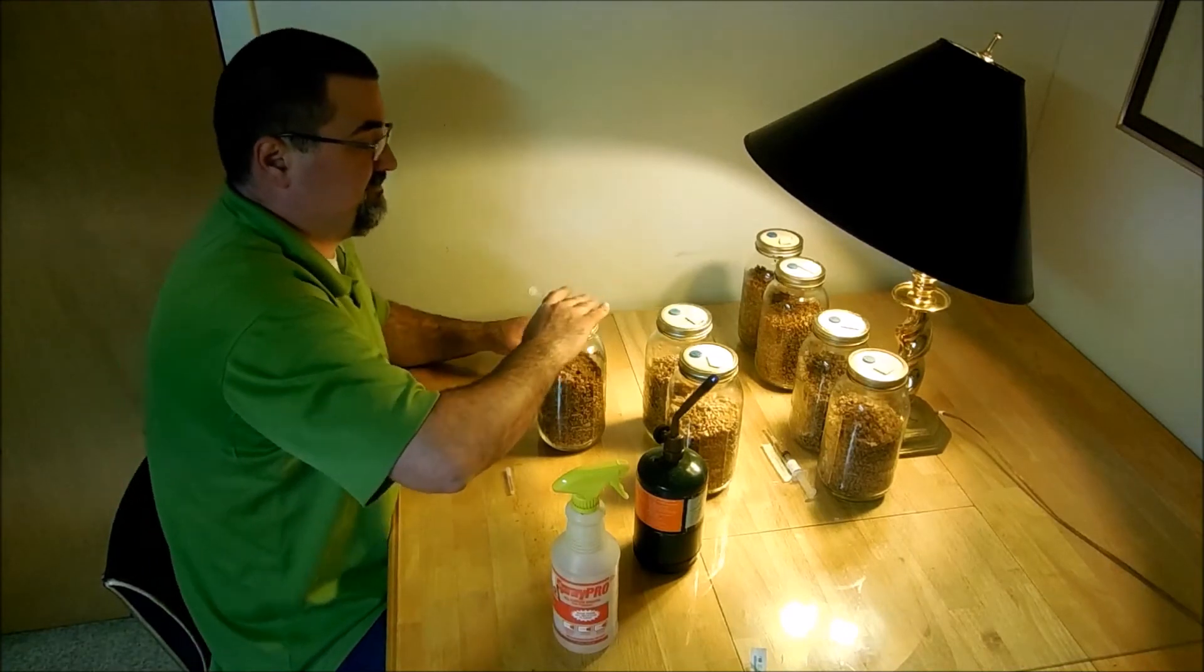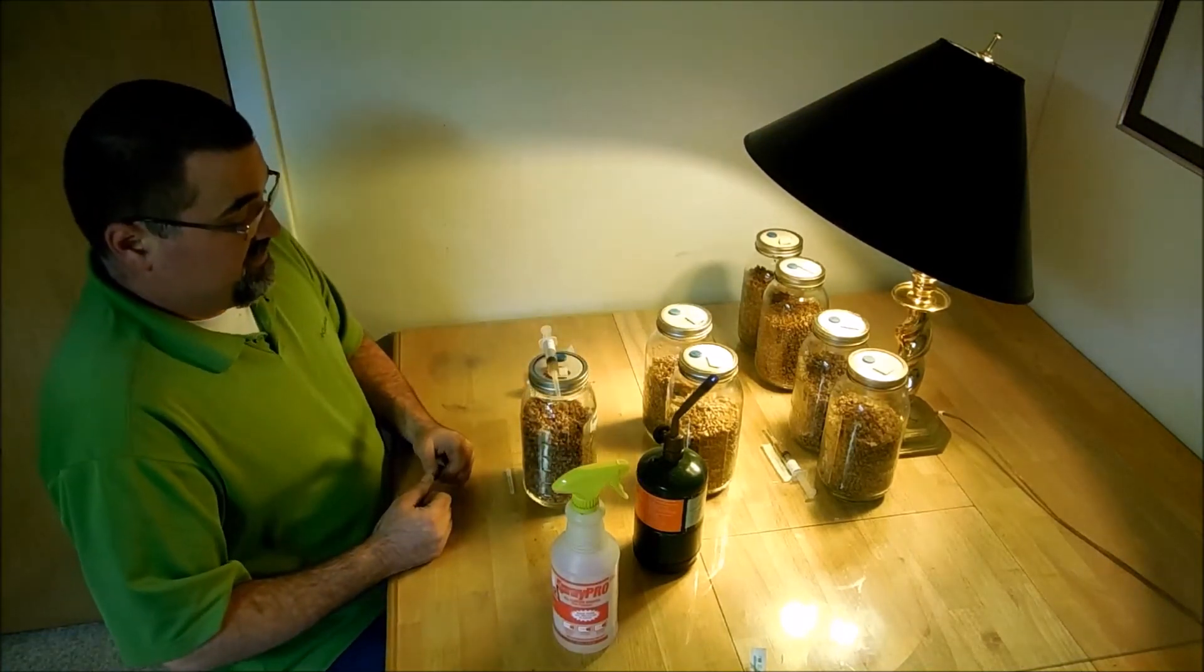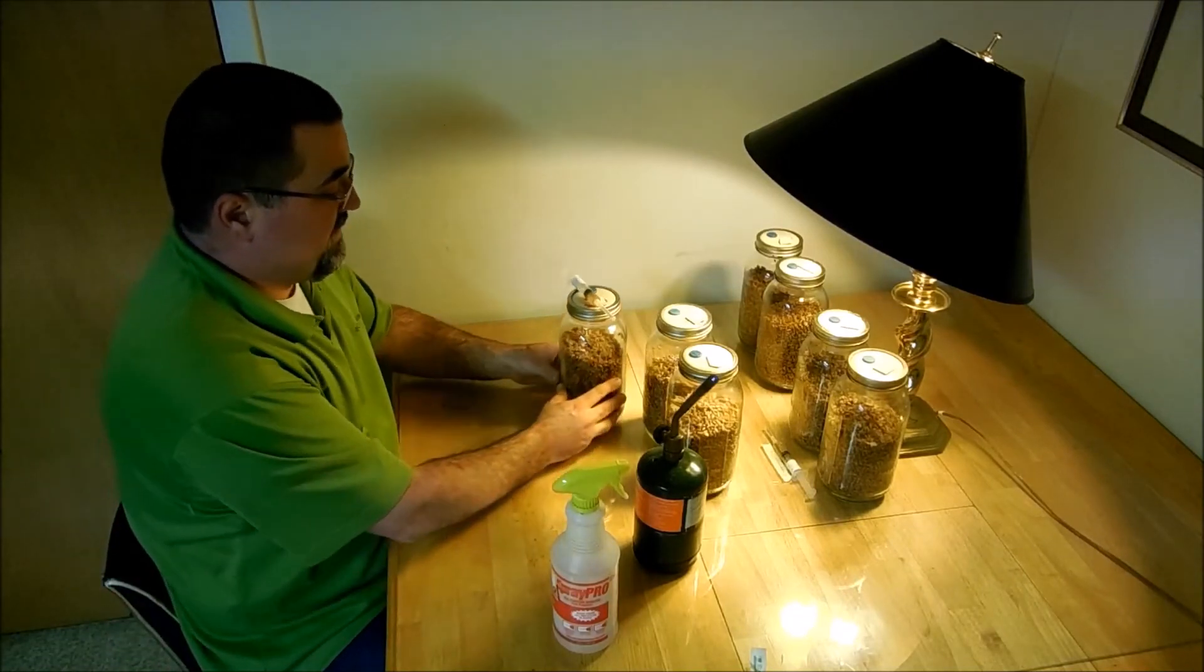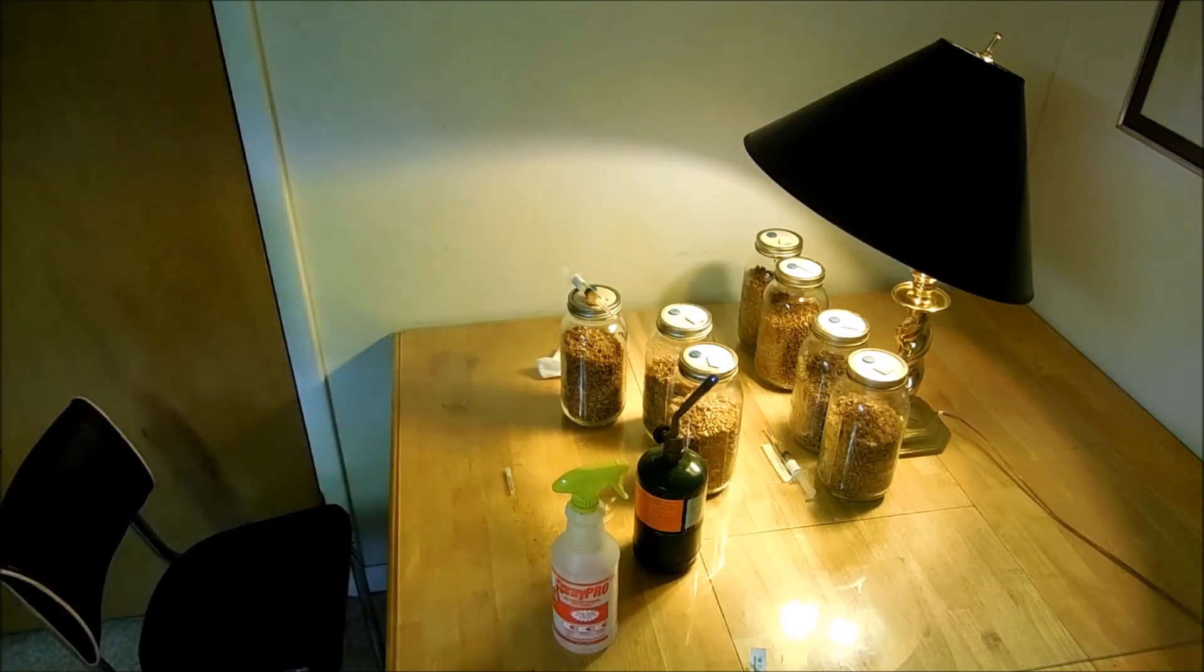Okay. Well, that's basically it. That's basically it right there. Now all we do is we wait a few weeks until this gets fully colonized.